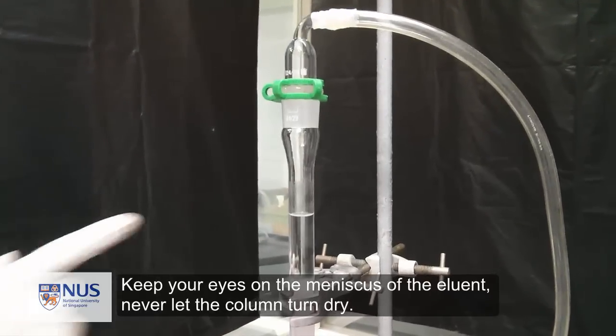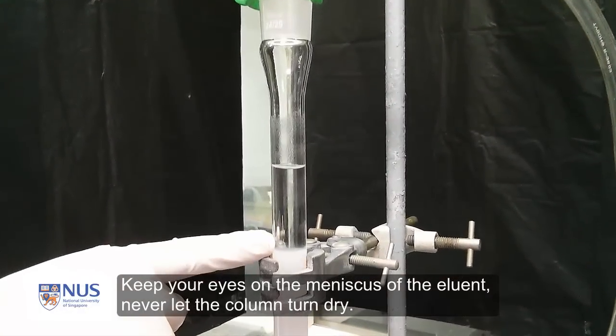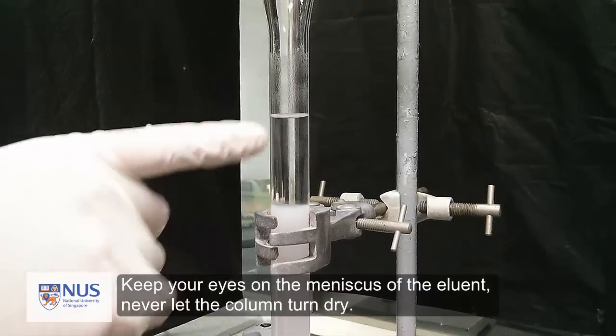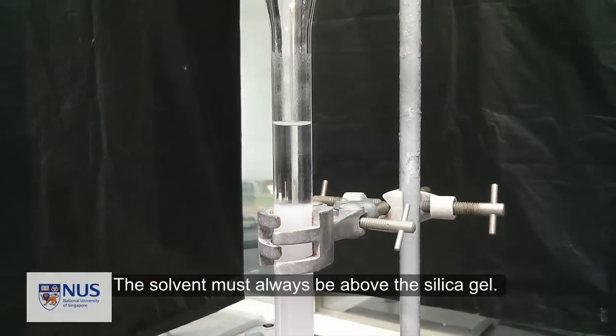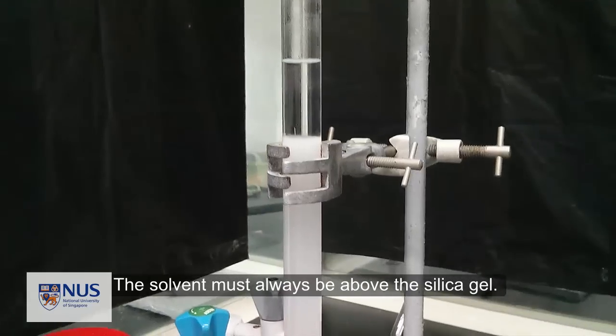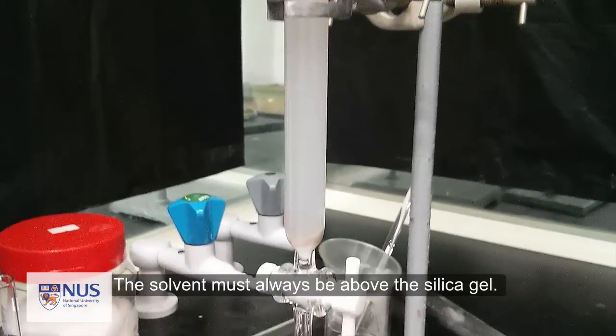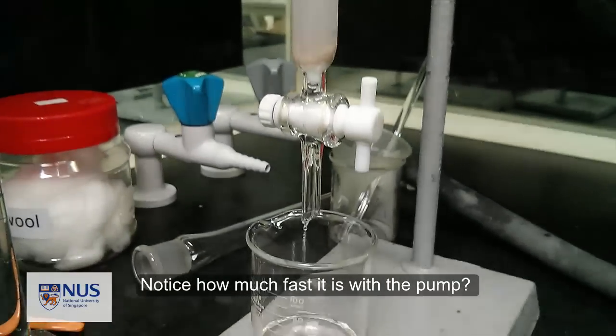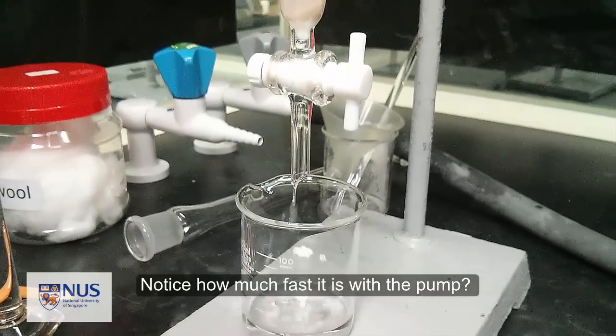Keep your eyes on the meniscus of the eluant and never let the column turn dry. The solvent must always be above the silica gel. Notice how fast it is with the pump.